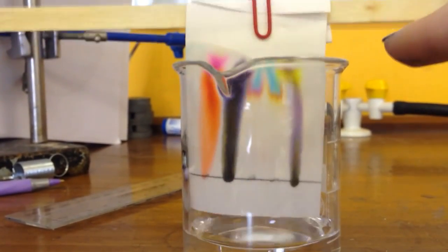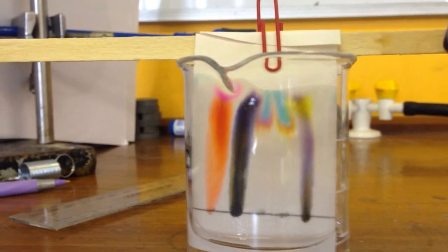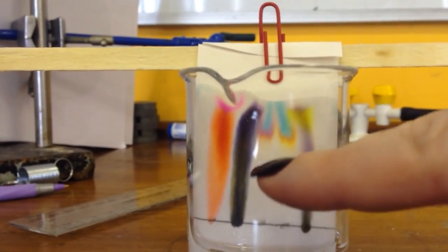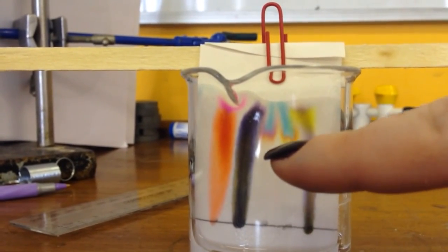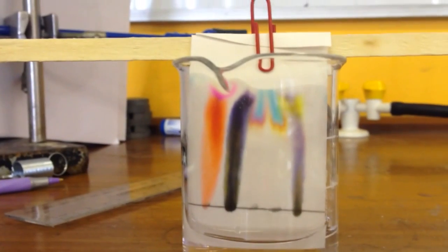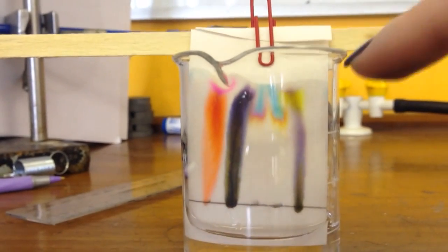So the red, we've got some nice pink at the top there. And red. The black starts off black. We can see some blue, some greens in there, and then it goes to a purple.